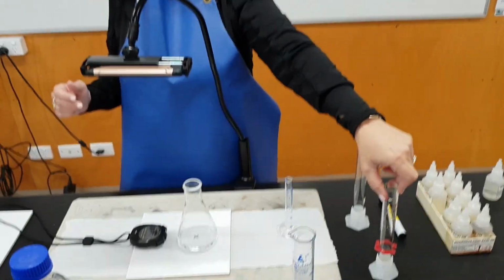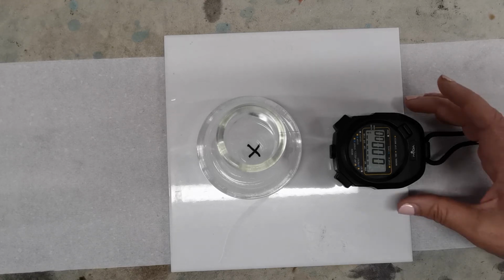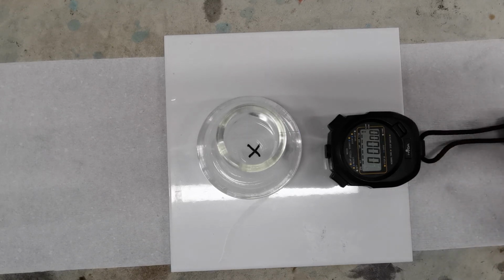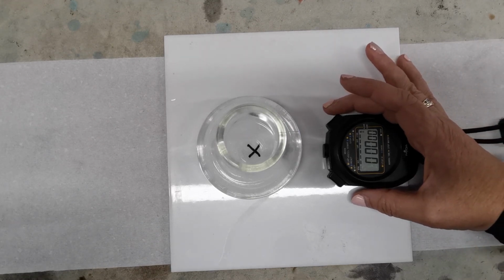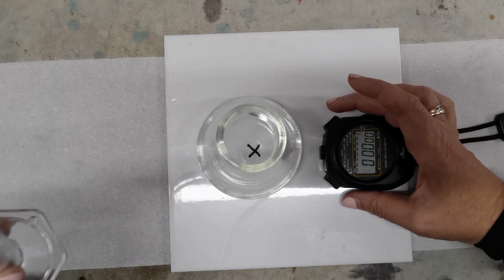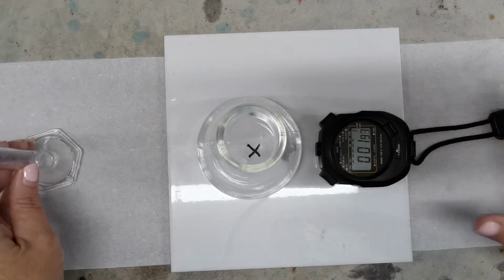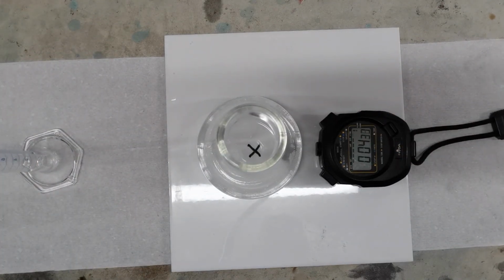You'll need to write down the materials list for this practical. And in our 10 ml measuring cylinder we've measured out 5 mils of hydrochloric acid, which is at a concentration of 2 molar. Again, we're going to pour the acid in and observe to see when the precipitate is, what can we call it, crowded in that solution that we can't see the cross. Okay, we started our stopwatch.